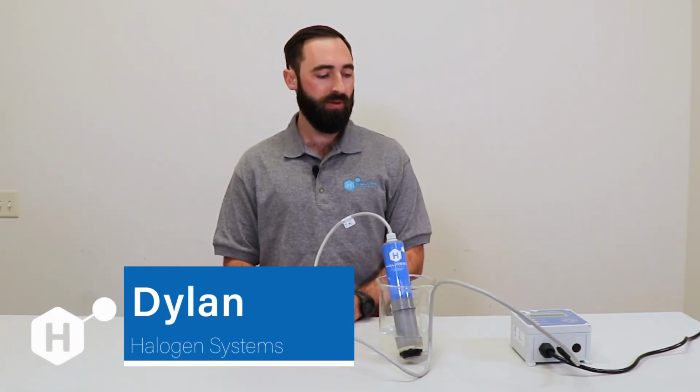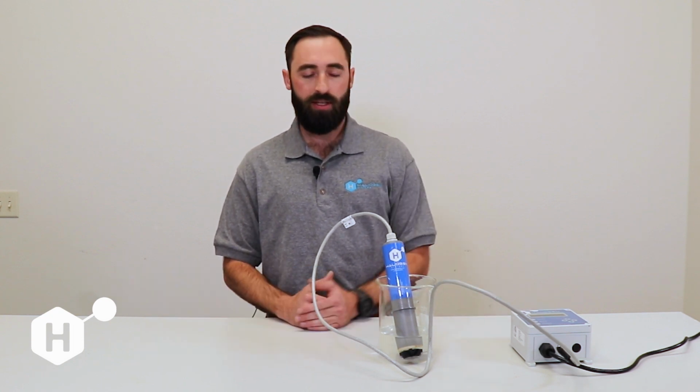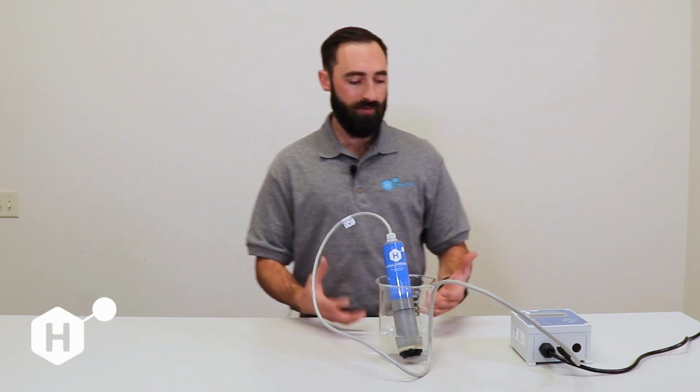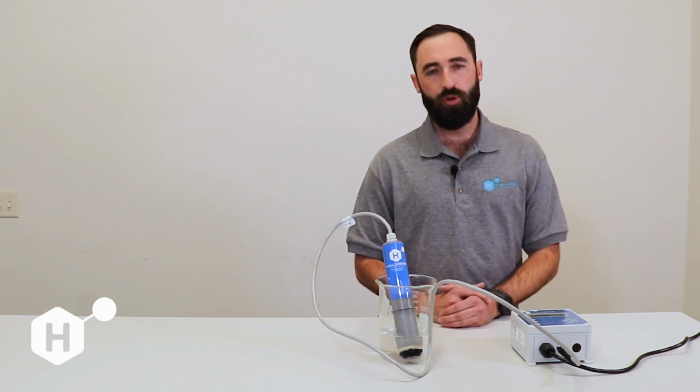Hi, I'm Dylan with Halogen Systems, and today we're going to go through how to restore factory defaults, and how to use the long menu options, as well as talking about some maintenance and diagnostics abilities within the display screen. So first, I'm going to show how to restore calibrations to factory defaults.